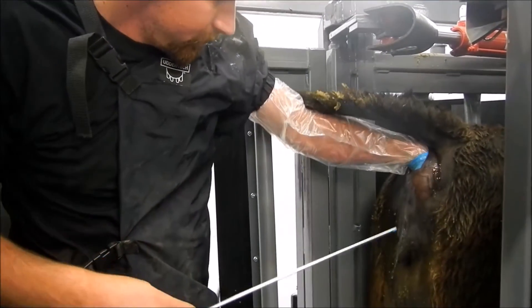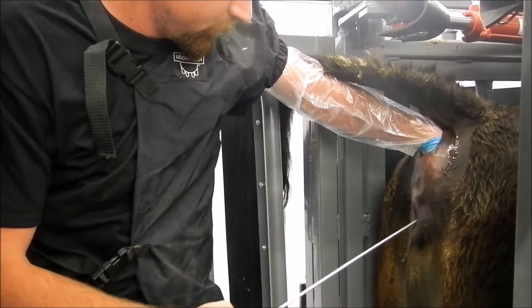At this point, we pass through the cervix and deposit the semen slowly in the uterine body.